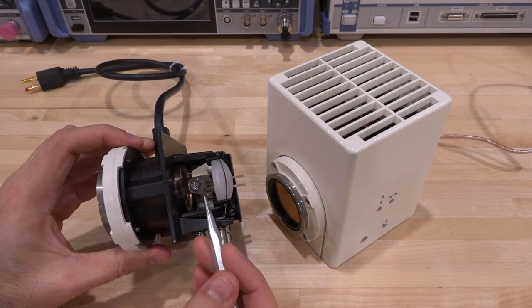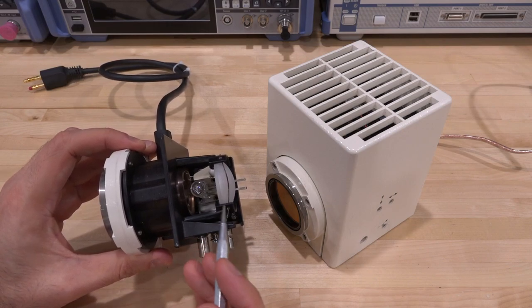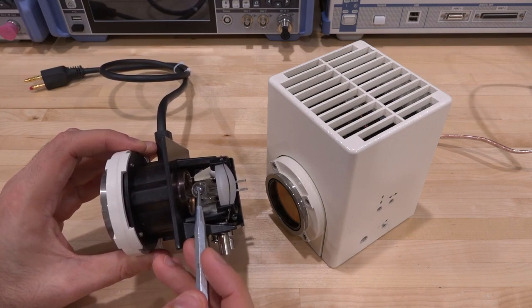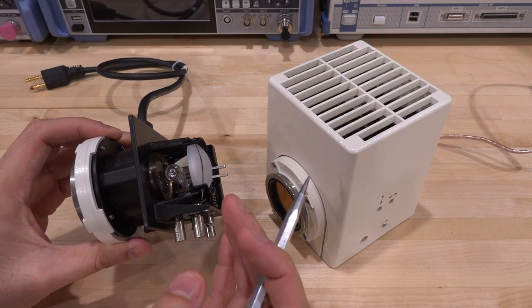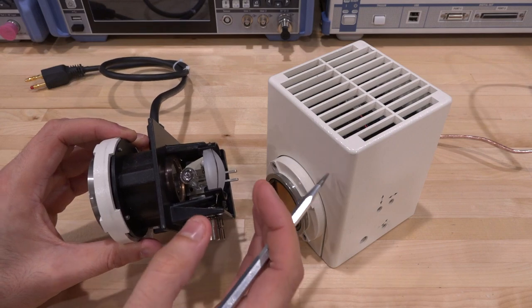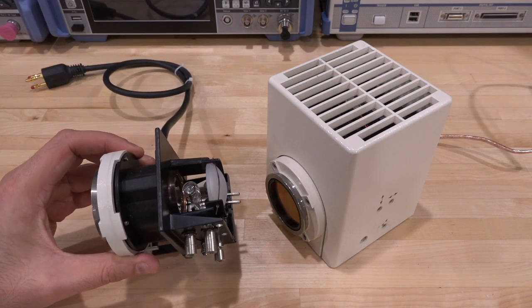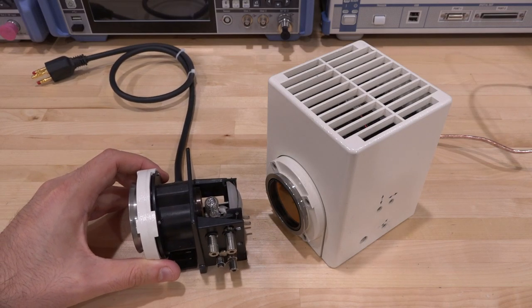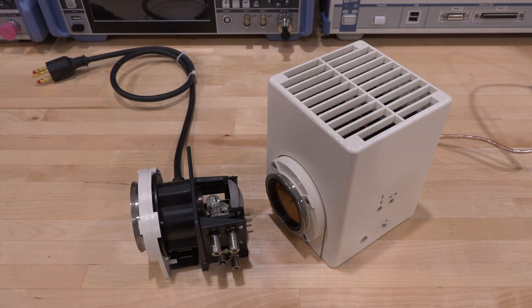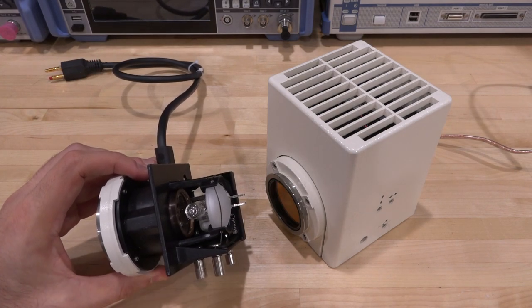Now, this is great because what you really want is a point source of light. And that's the point I was a little bit missing originally, because this is not a problem we can solve with optics later on. You can't have a big aperture of light, because ultimately all you can do is project your light source onto your sample. And for Köhler illumination, you want a really perfect projection of that. So the larger the aperture of light is, the harder this problem becomes. And most of that light energy is completely wasted when the aperture of the light source is big. That's one of the reasons they use the halogen lamp here.